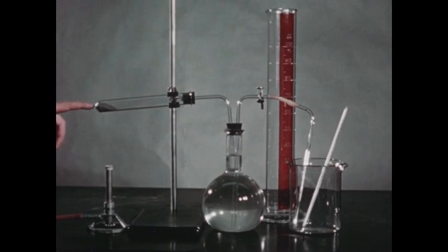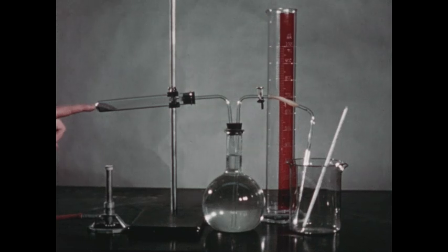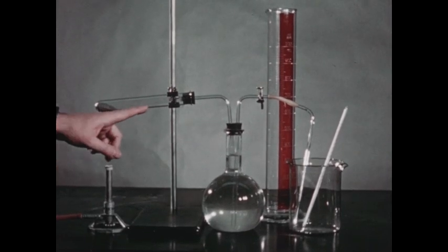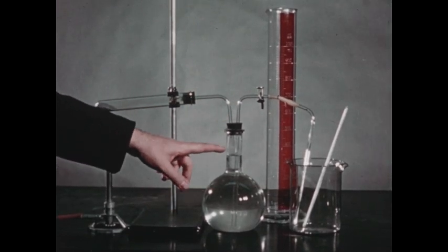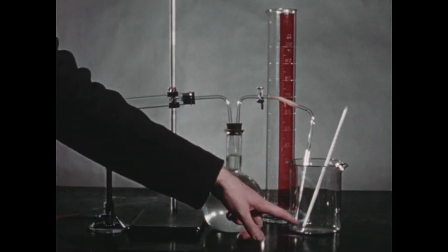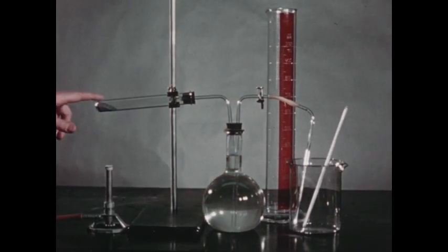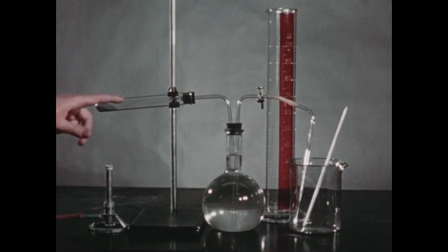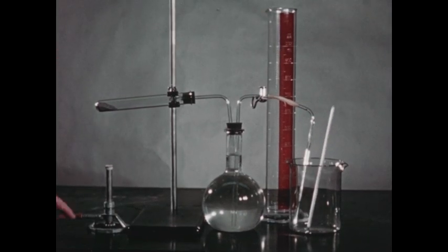In this test tube, we've placed a mixture of potassium chlorate and manganese dioxide. The grayish color of the material is due to the manganese dioxide. We'll determine the weight of this tube and its contents and then heat it with the Bunsen burner. Oxygen will be produced and driven through this tube, which opens into the flask. As oxygen enters the flask, the water in the flask will be displaced through this tube into the beaker. By measuring the volume of the water collected in the beaker, we can determine the volume of oxygen produced. By weighing the tube before and after heating, we can determine the weight of the oxygen produced. We can measure the pressure using a barometer and the temperature of the oxygen by measuring the temperature of the water driven from the vessel.